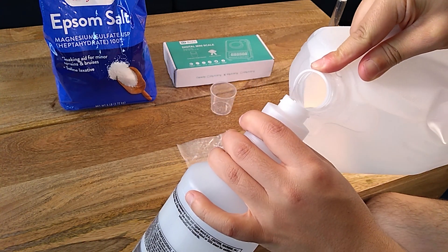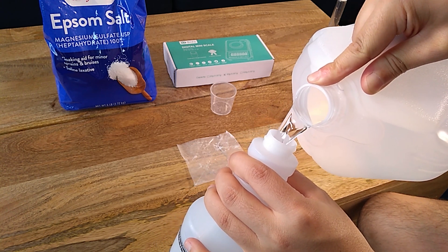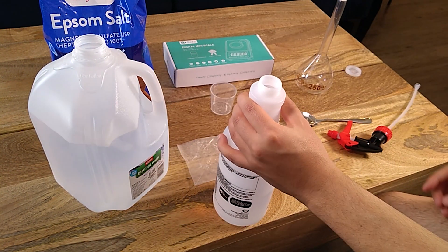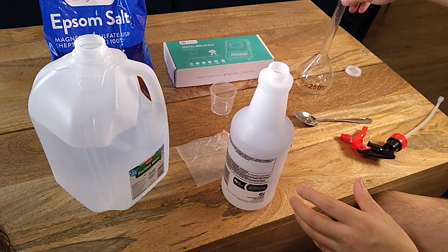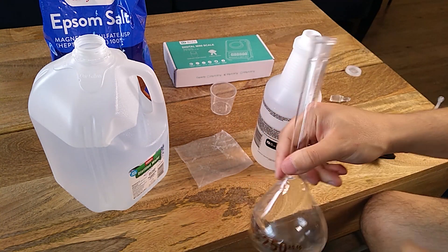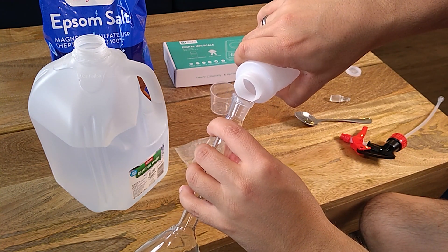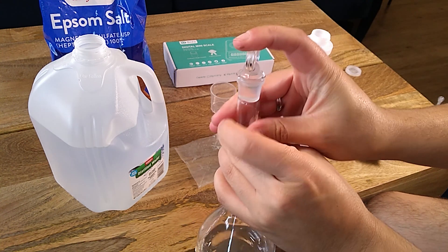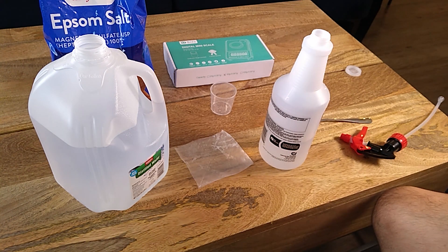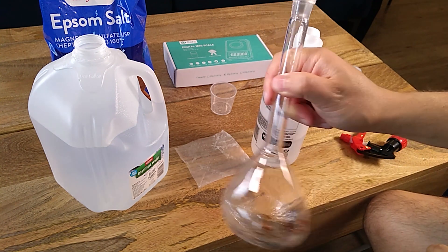Now I'm just going to fill it up, not to the brim, but just enough for what we're going to do now. And now we want to also purge our volumetric flask. With the water that I put in there, I'm going to do it once, give it a good swirl. This has a stopper so you can just shake it a little bit, ensure you purge everything. Just three times, which is what we usually do in chemistry.